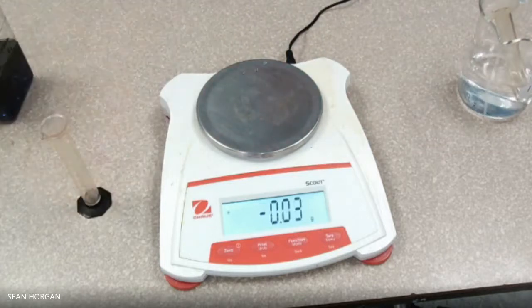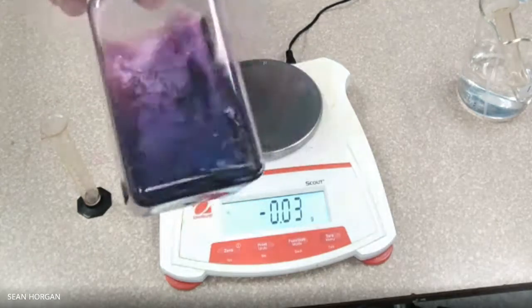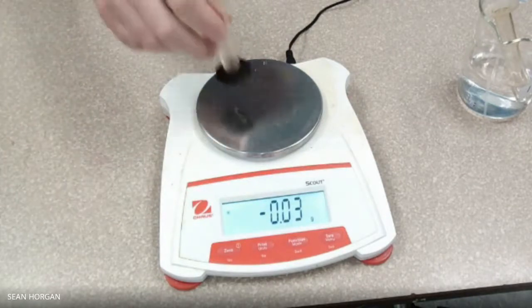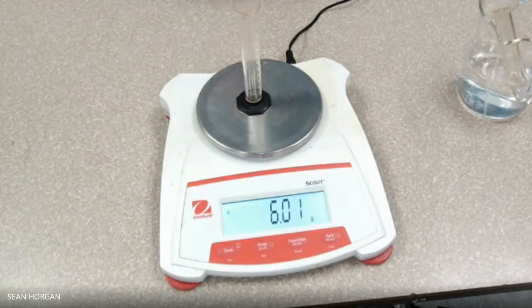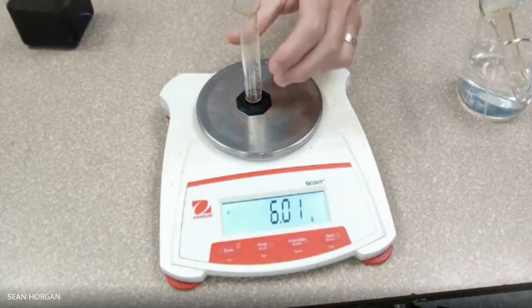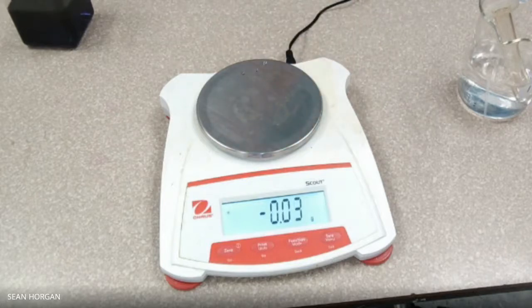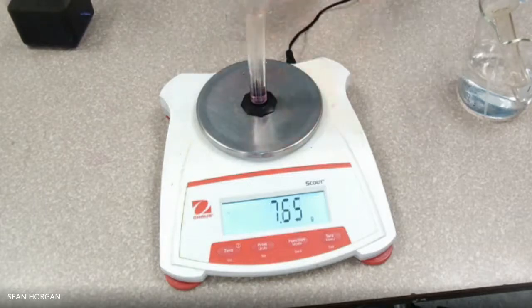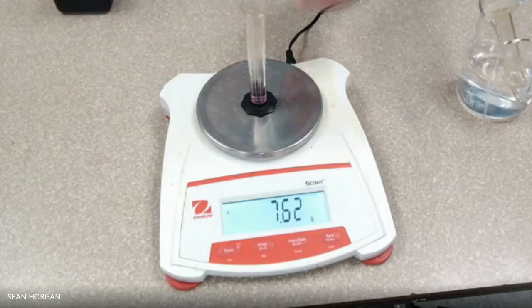And now we're going to do the same thing using a different graduated cylinder. This time we're going to look at the unknown — purple. First things first, put that on there and make sure we take the reading — that's the mass of the empty graduated cylinder that I'm going to use for the unknown. We measure to the bottom of the meniscus. There's our mass of two milliliters of the unknown.